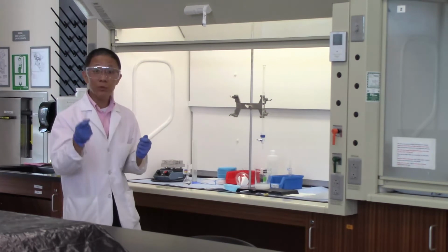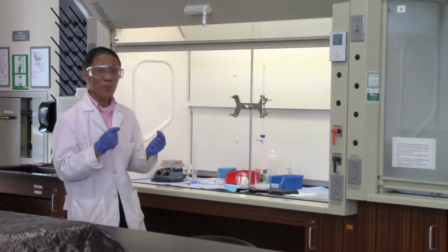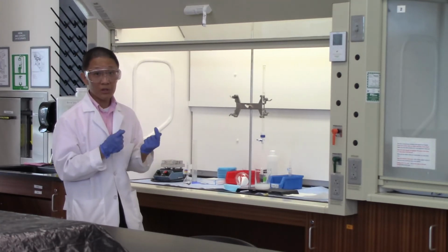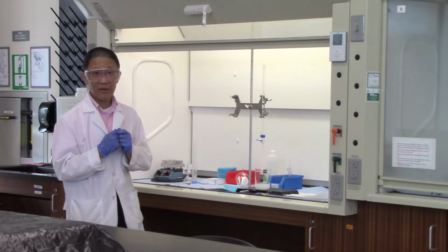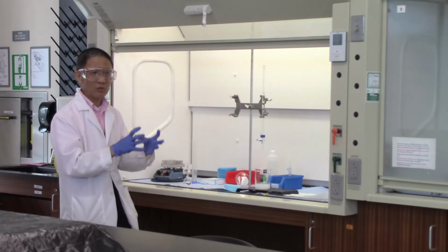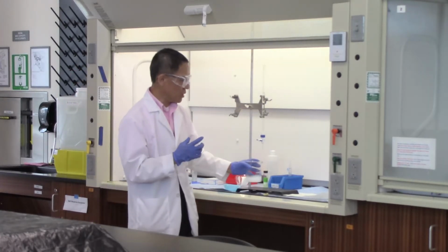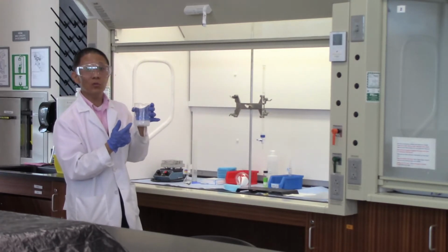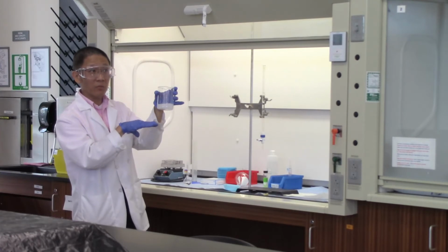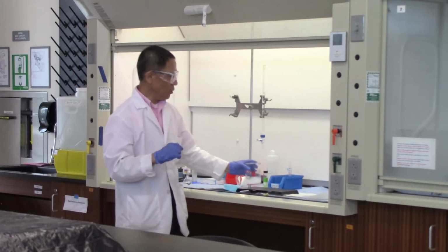Digestion actually promotes the formation of larger crystals. Larger crystals make it easier for us to do filtration and also give you better purity for the sample we're trying to collect. This may take a good 30-40 minutes before the solution gradually cools down to room temperature. Once the solution cools down, we want to make sure by that time all of the precipitate will settle on the bottom of the beaker, so the top liquid in the beaker would be clear.